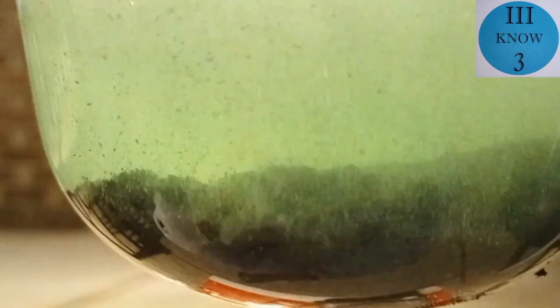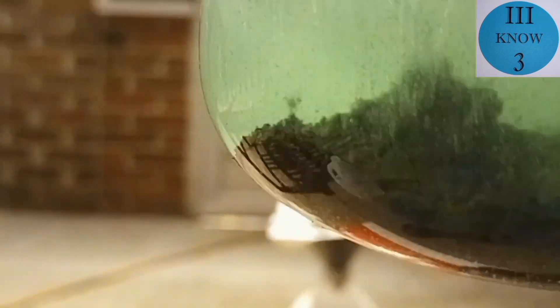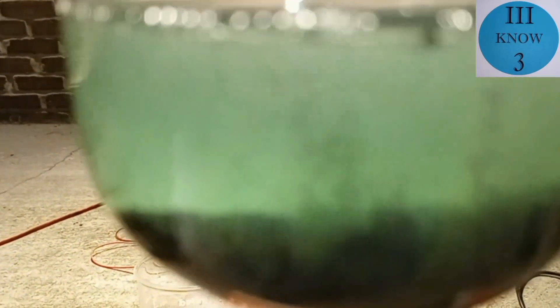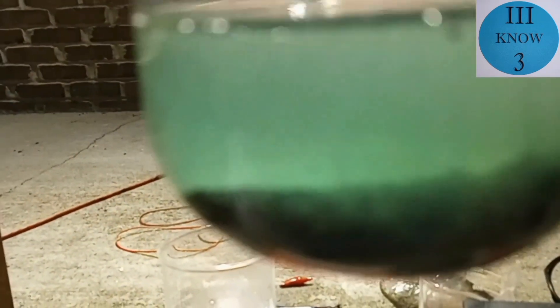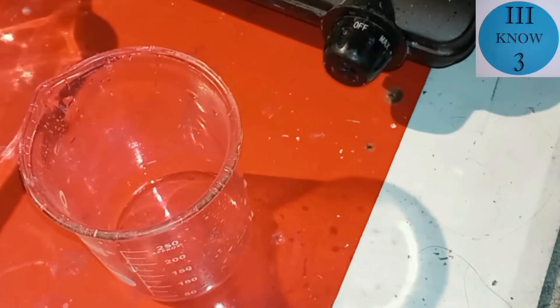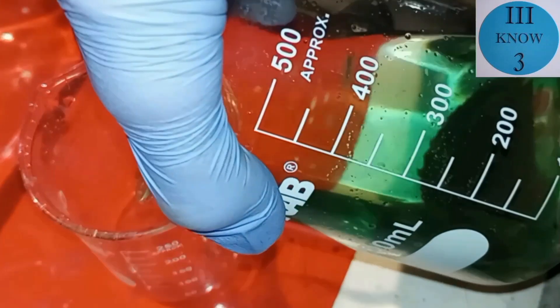And here you can see the solution looks green like nickel chloride and you can see that the copper is remaining undissolved. The little volcanoes are probably pieces of nickel that are mixed in causing these little eruptions. Right in the middle of this nice green solution is what looks like pure copper.